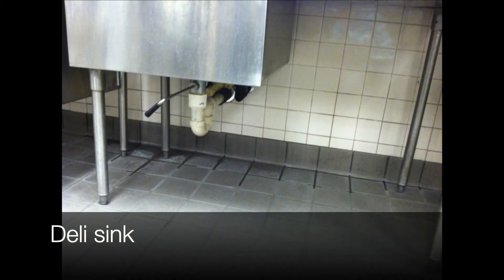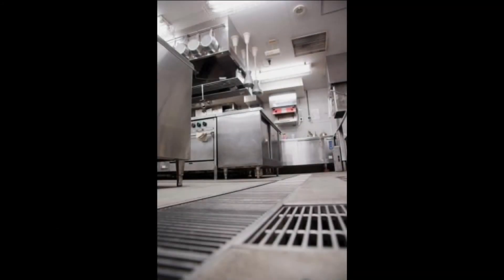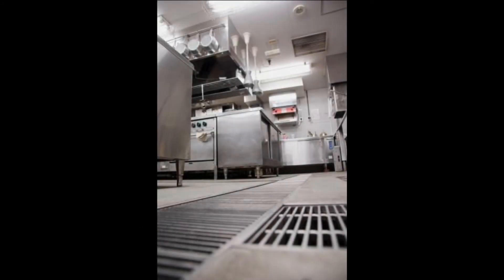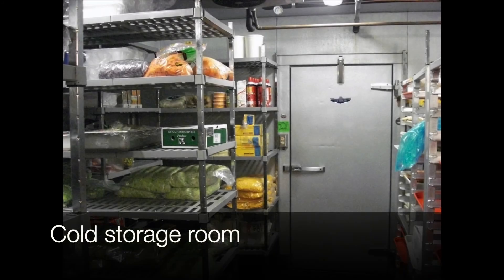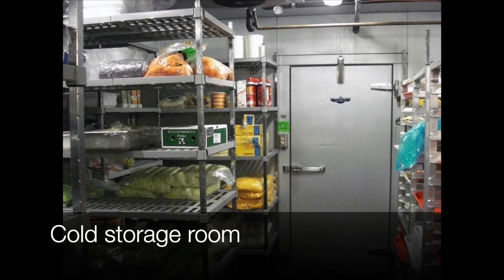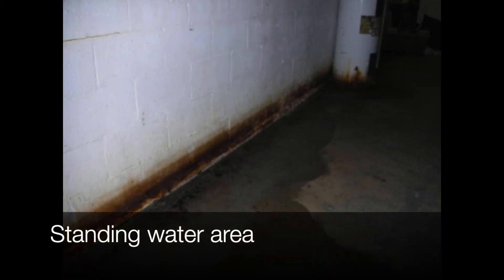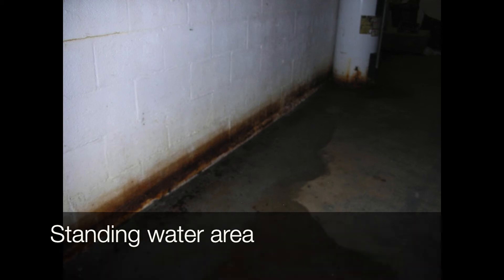Deli sink interior and exterior. Drain and deli area. Cold storage room: Spend some time in these cold rooms. These are essential to sample when looking for Listeria. Also focus on difficult-to-clean areas and areas with standing water.